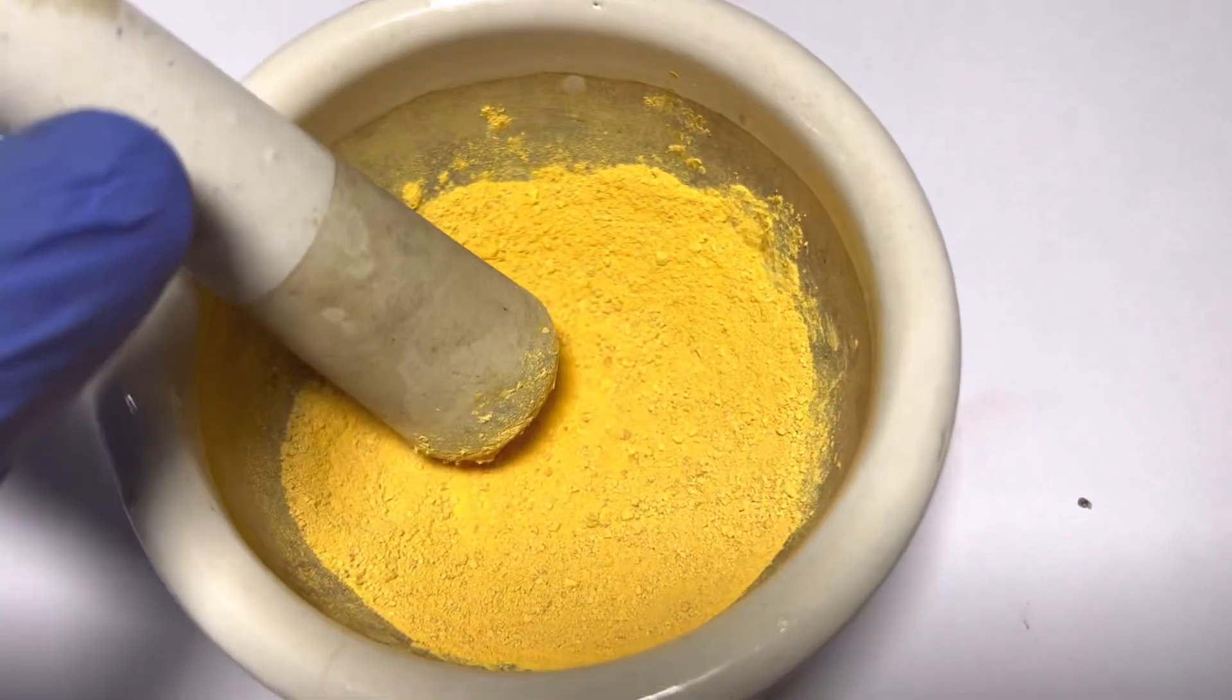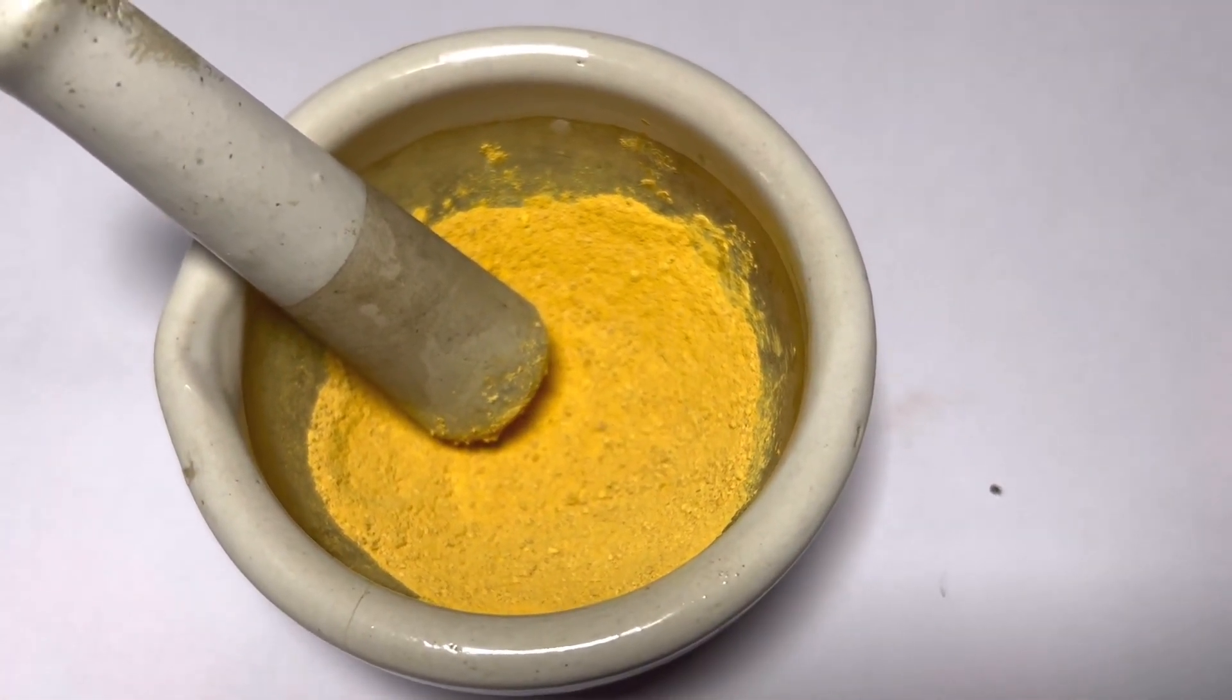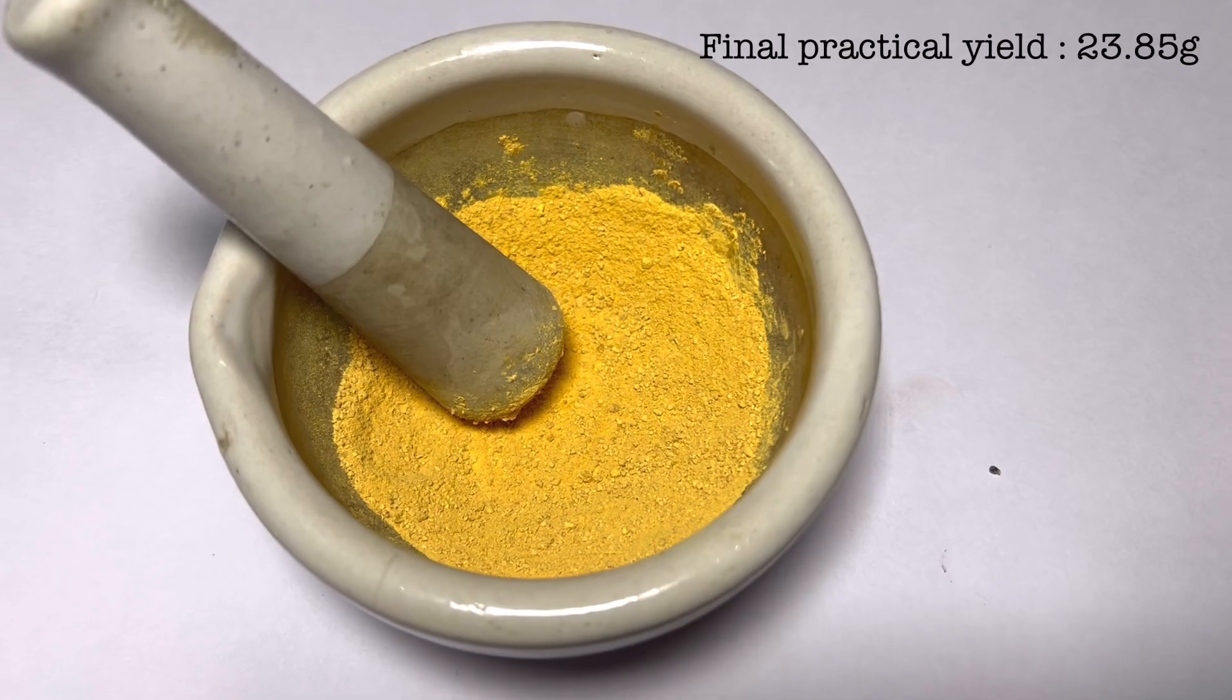This is the final result of sodium bismuthate. The final yield that I got was 23.85 grams.